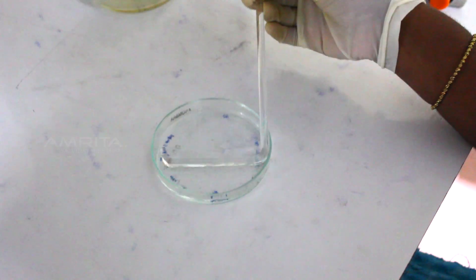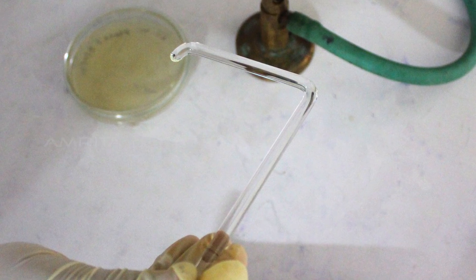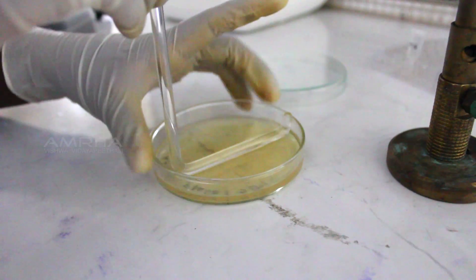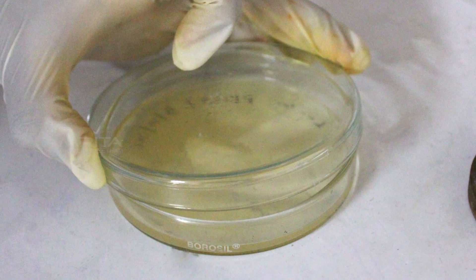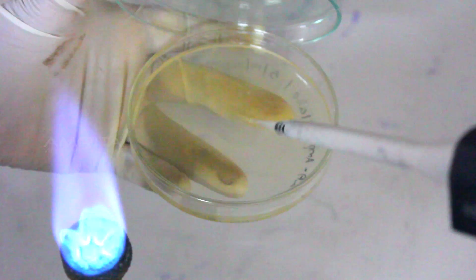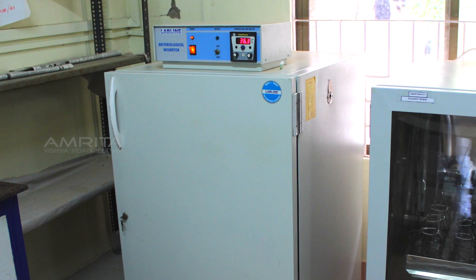Now dip the spreading rod in ethanol and burn it in the flame. Allow it to cool for some time. Using this rod, spread the solution in the petri plate evenly. After spreading the solution, close the petri plate. Ensure that the process of adding and spreading the solution in the petri plate does not take too much time. Finally, place the petri plate in the incubator for 12 to 16 hours.